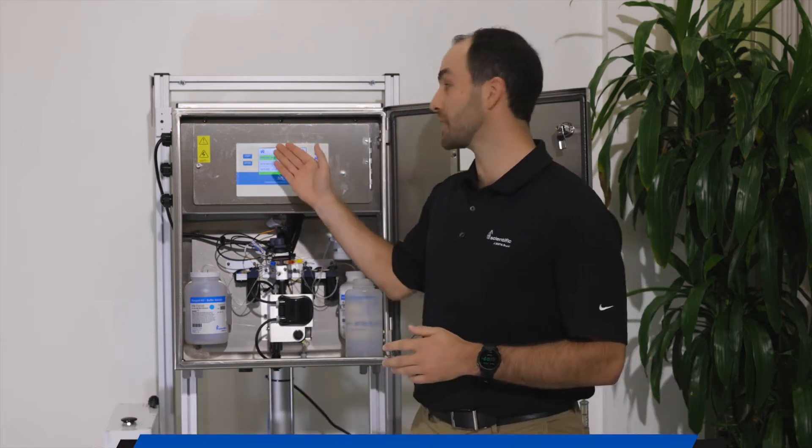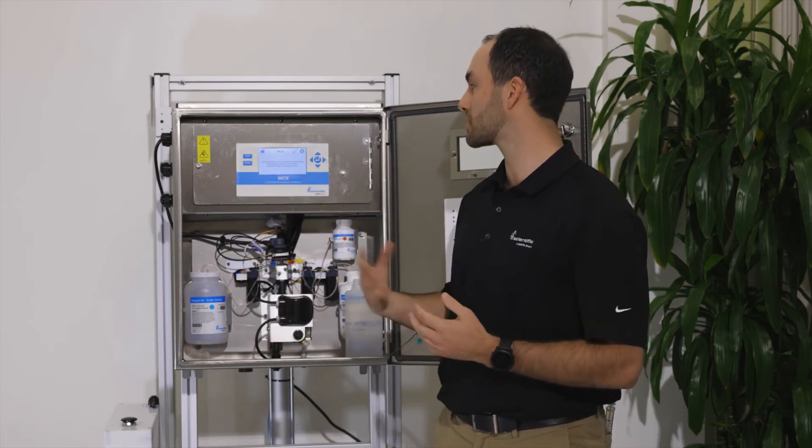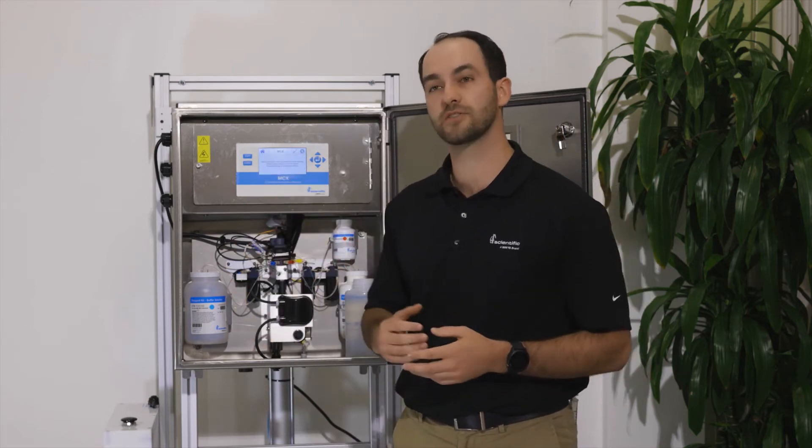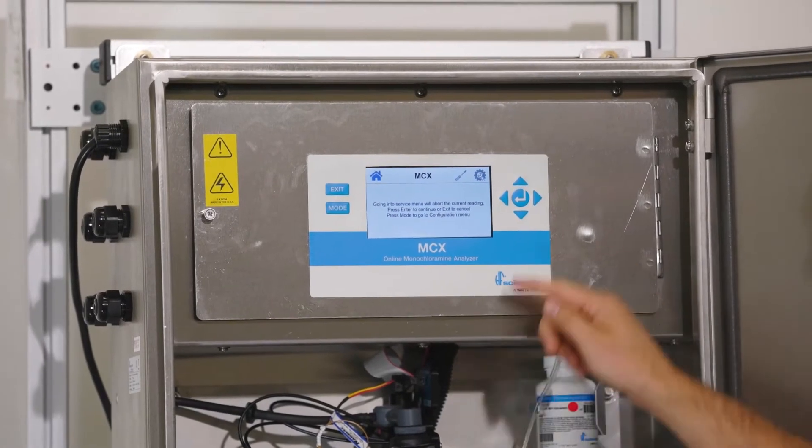We'll start on the screen. To put the analyzer into a service mode, press the Mode button once. The screen will prompt you that if you press Enter, you will abort your current reading, which is fine while we change the reagents, so we'll press the Enter button.